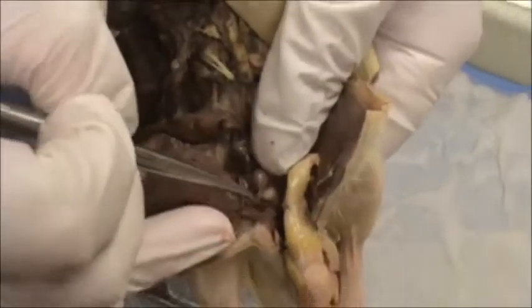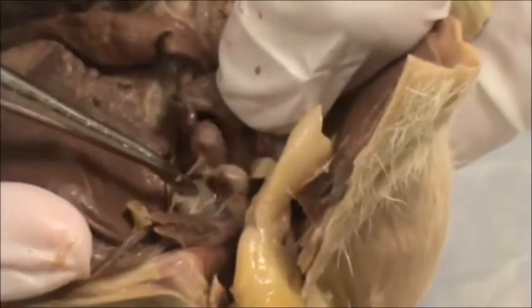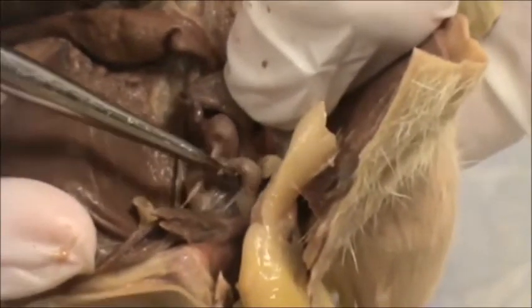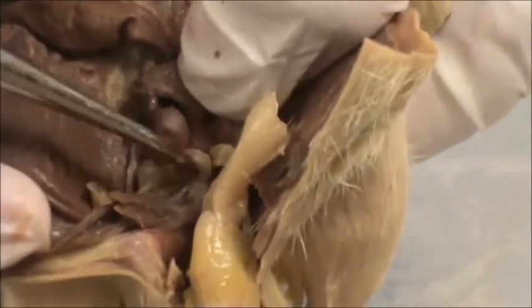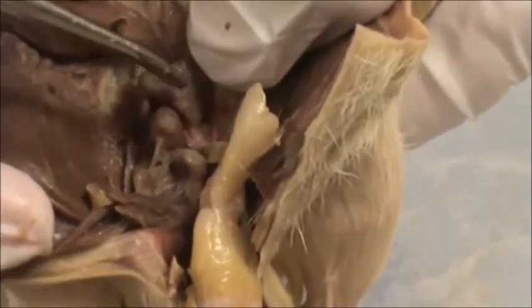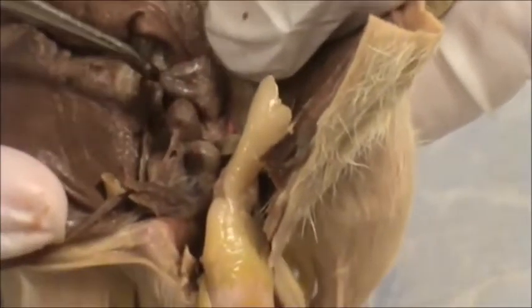In front of the bladder is the prostate gland, and it looks like a clover to me — it's got one prostate, the urinary bladder, and the other prostate. So you have two prostate glands. These glands make semen for the sperm.